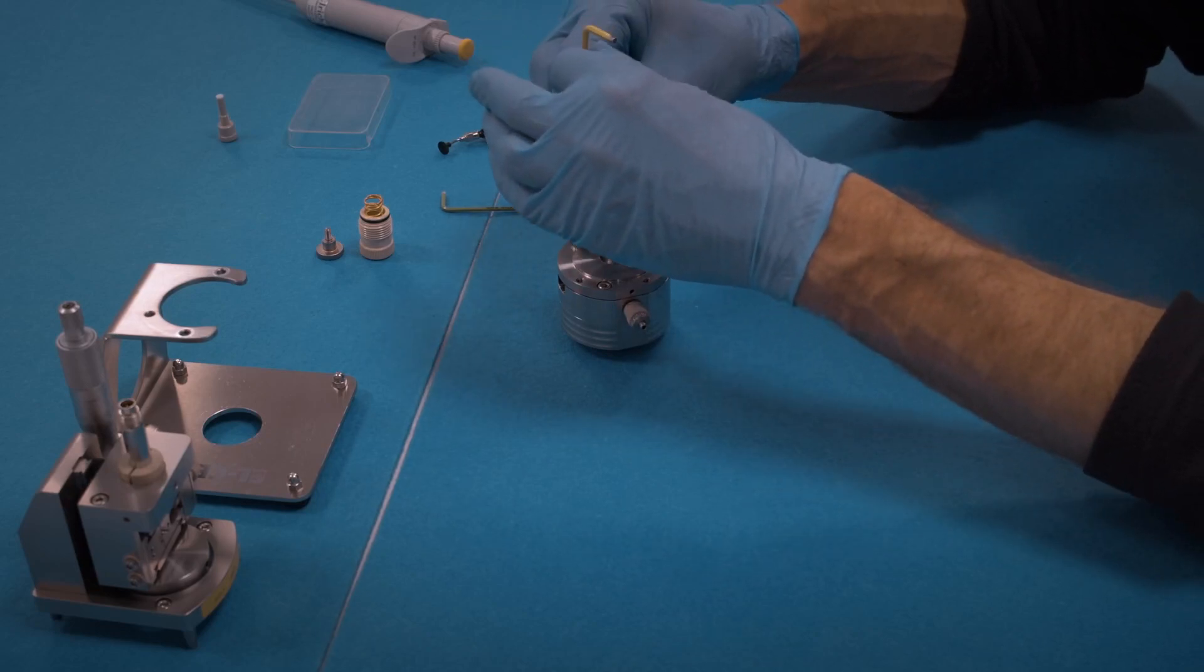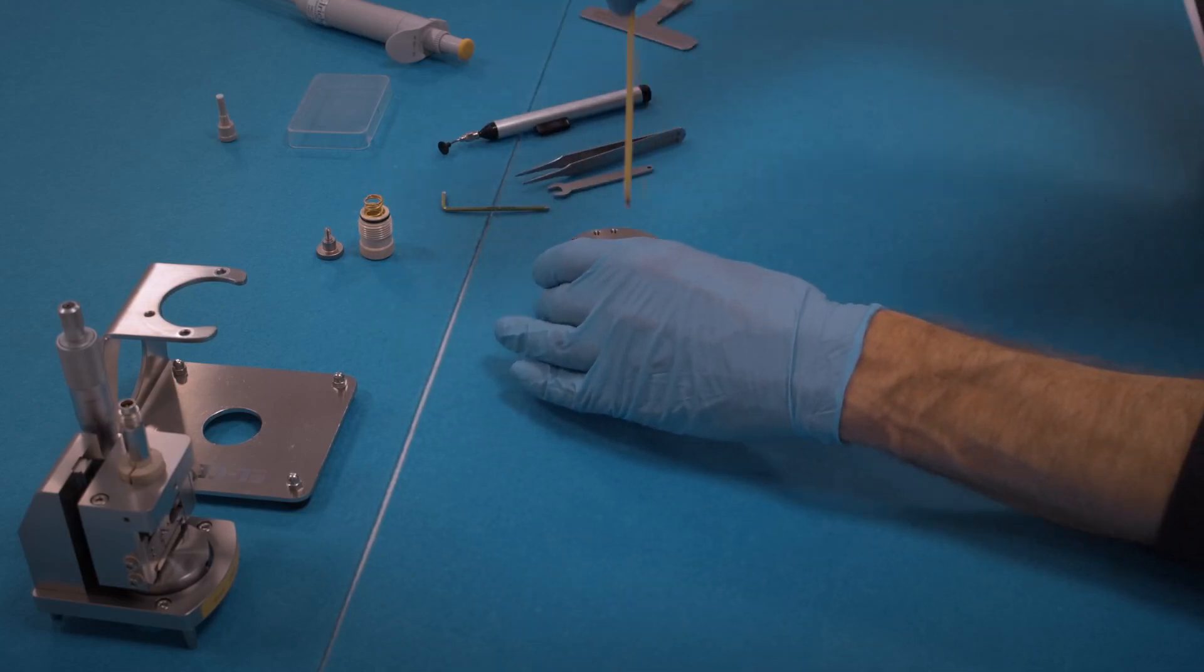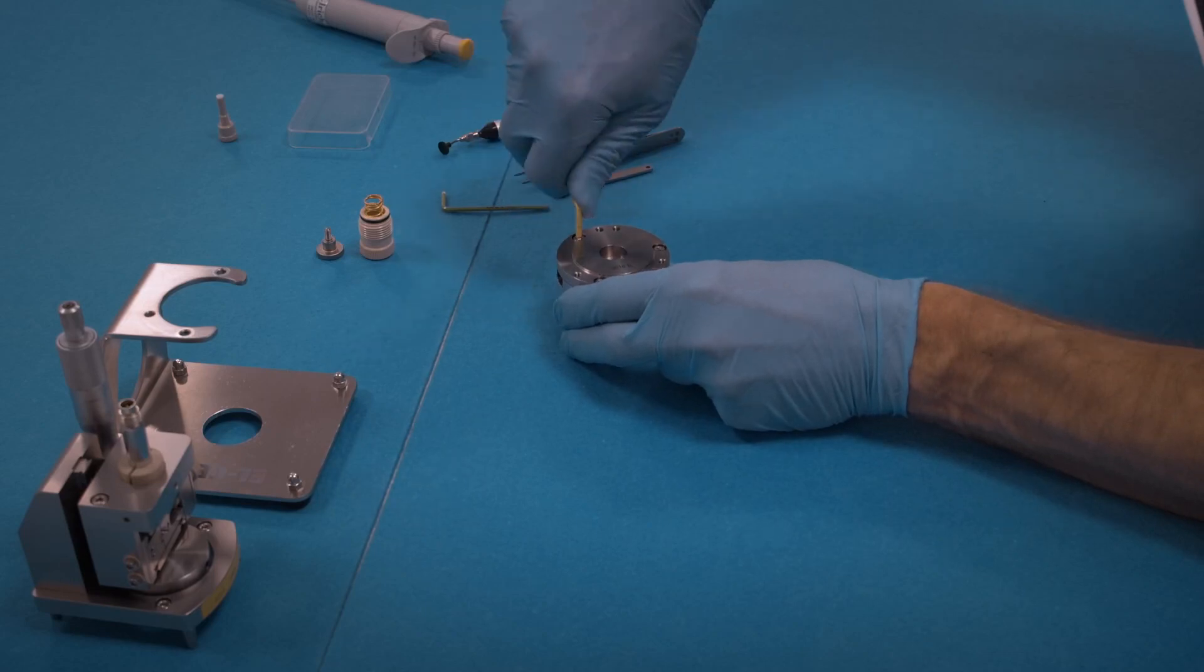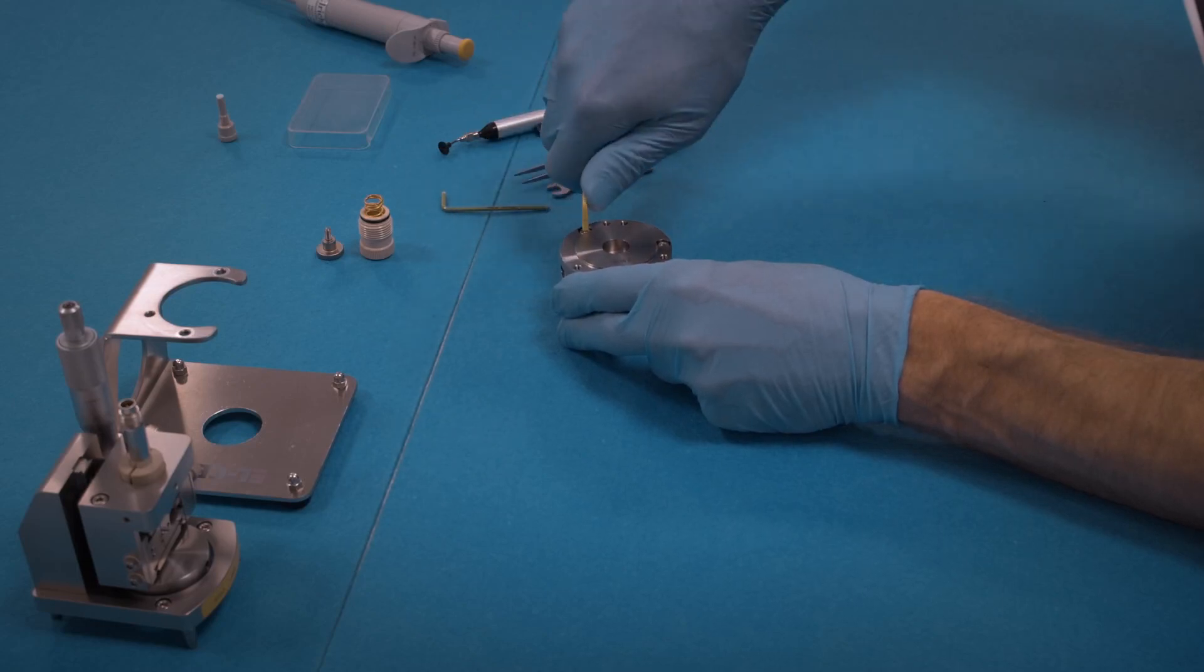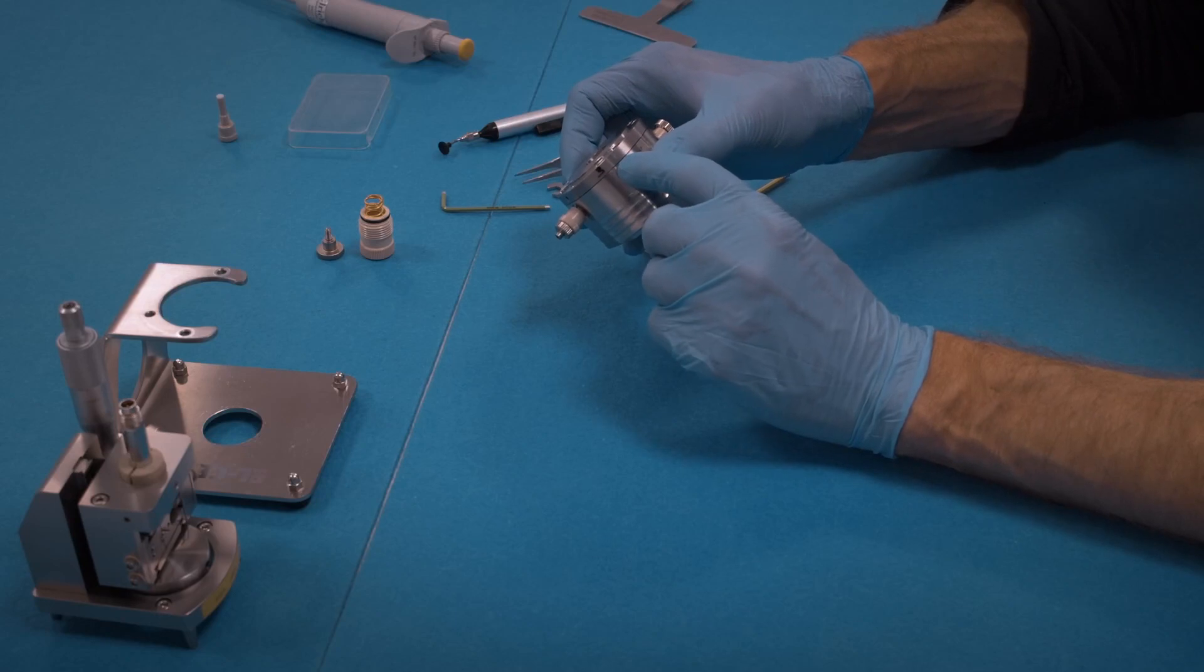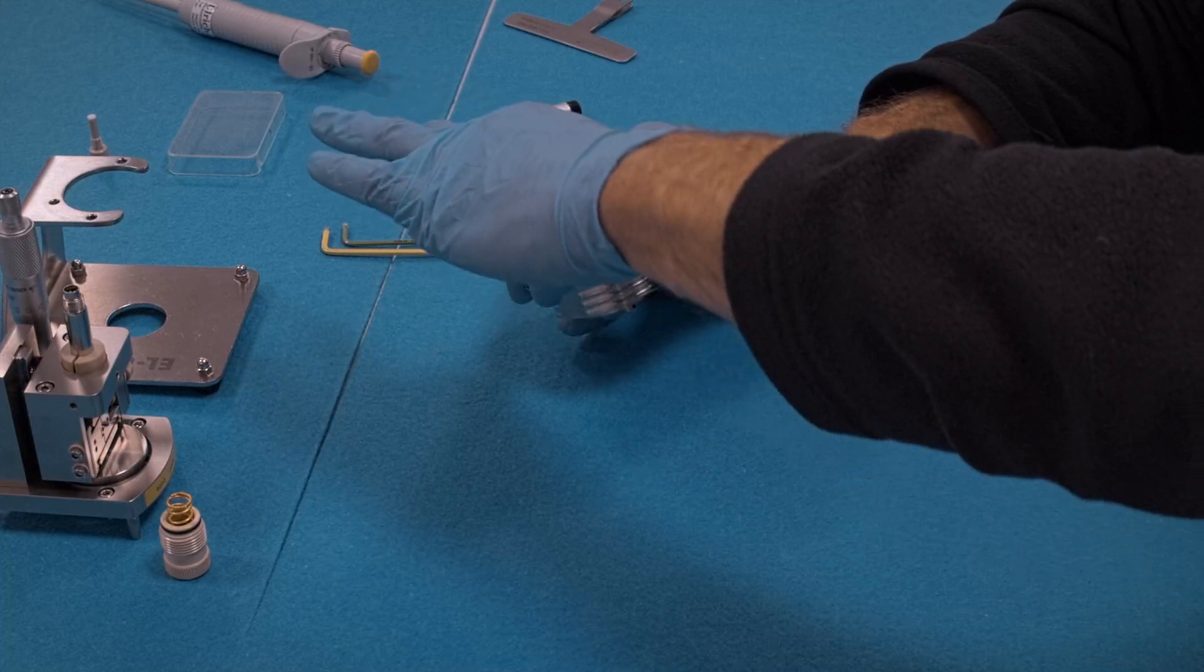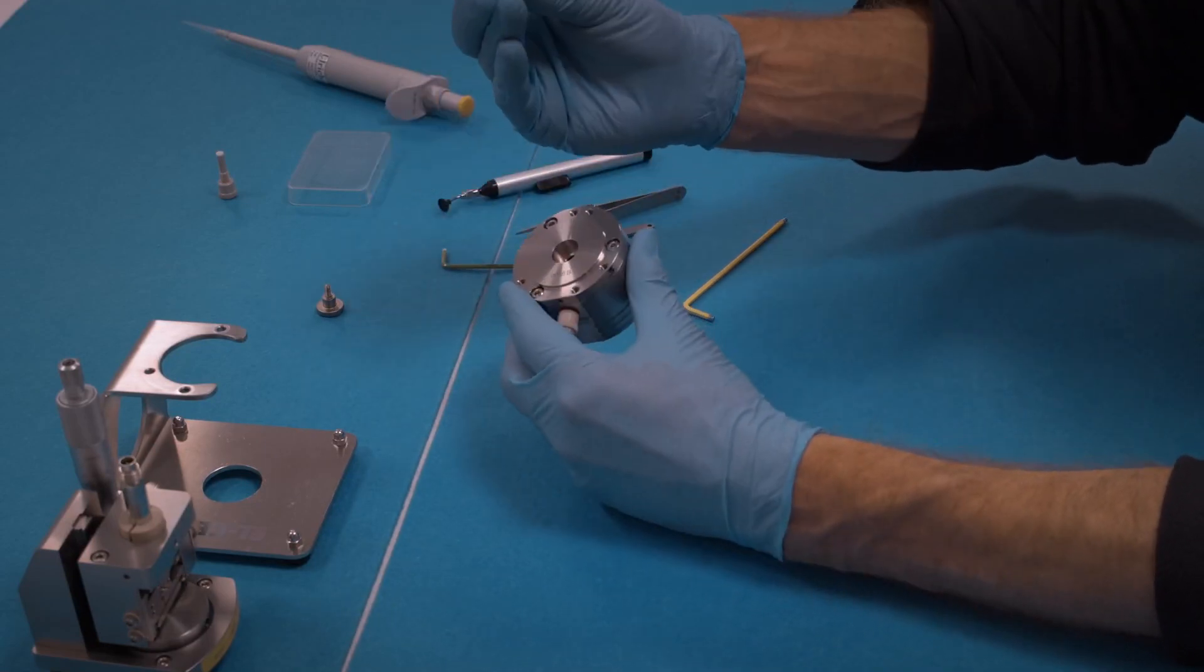The PTFE seal used to seal the metal foil is significantly thicker than with the previous version of the dilatometer, so you have to apply significant force here to compress and tighten the cell. Make sure that the gap between cover flange and base is completely closed. Then firmly tighten the reference electrode and screw in the spring load from below.